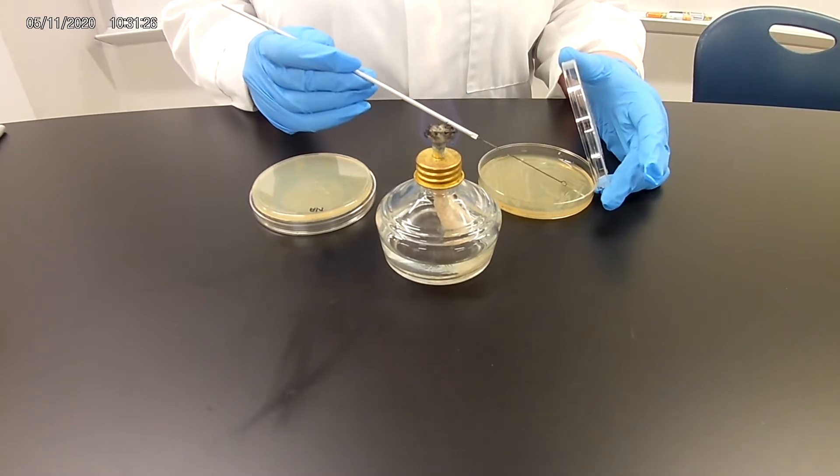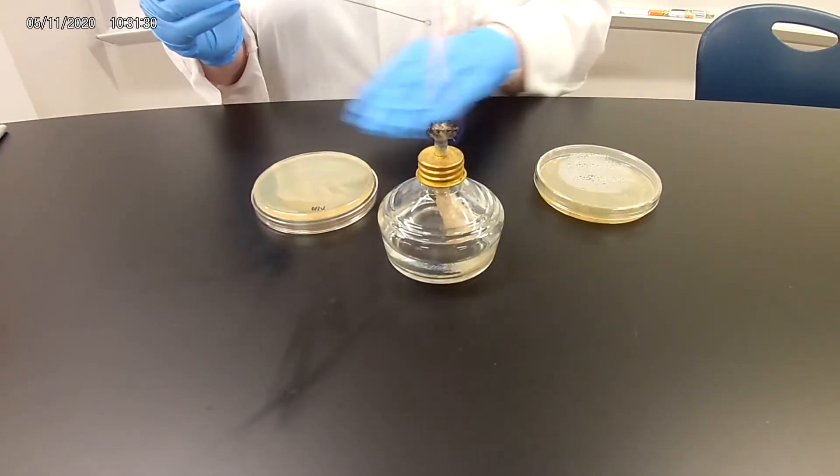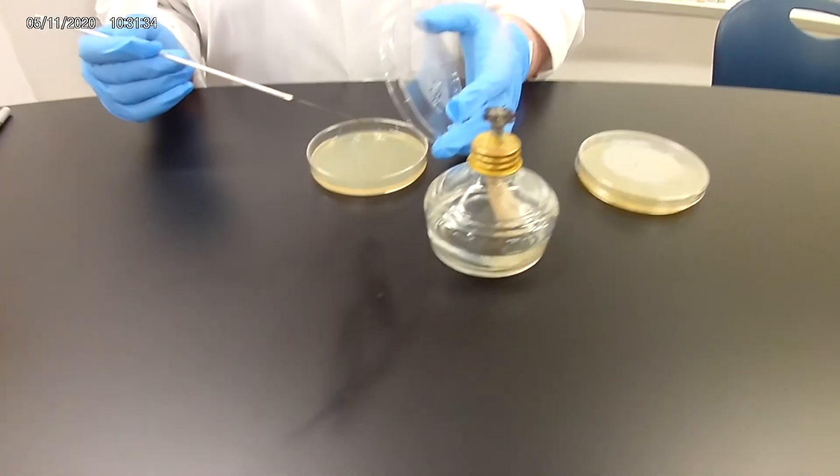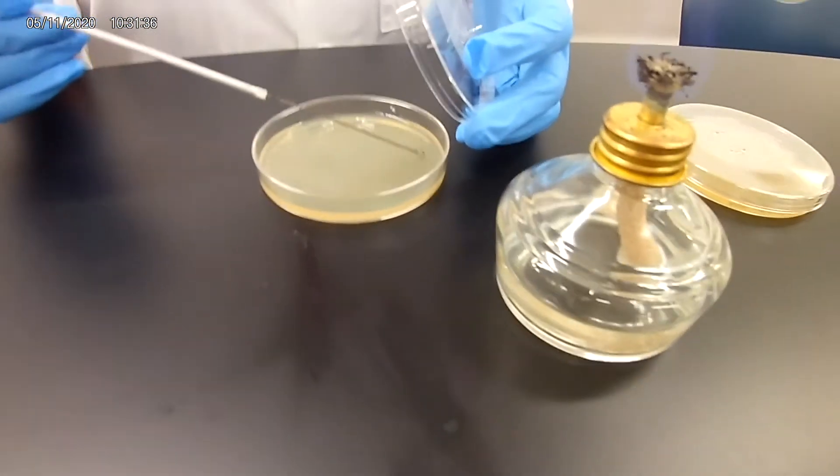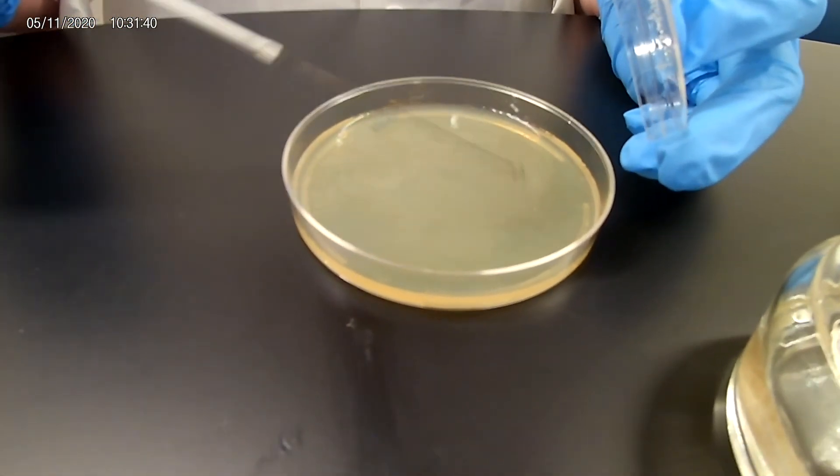I'm going to take a culture. There's a couple different ways you can do this, so I'm going to show you one way first. You take a culture, go to your new plate, and you're going to streak, spread it out in one quadrant area.